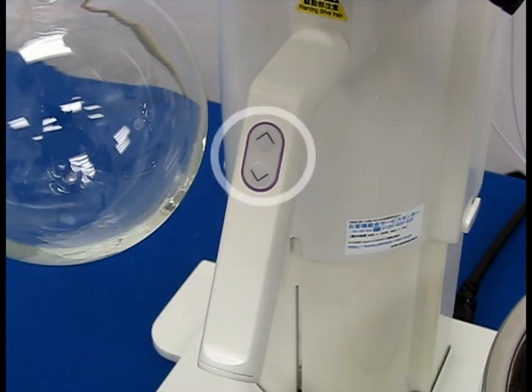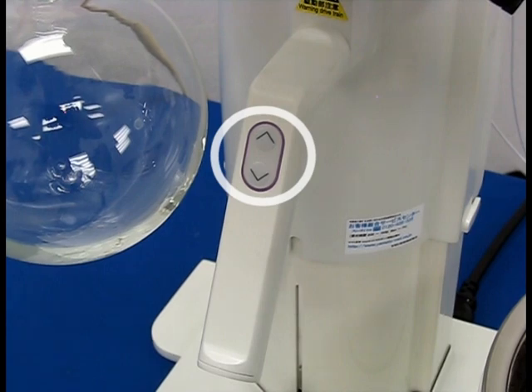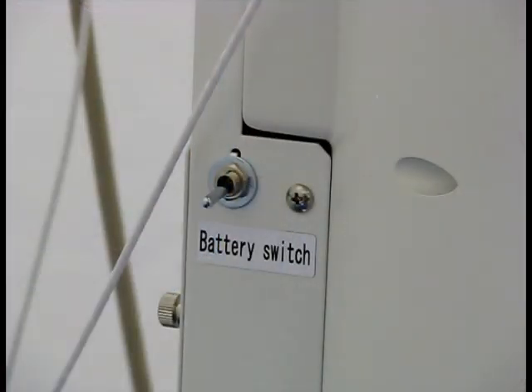The height can be adjusted with a mechanical lift by pressing the arrow buttons on the lift handle. A backup battery below the back panel can supply power to the lifting mechanism in case of power source failure.